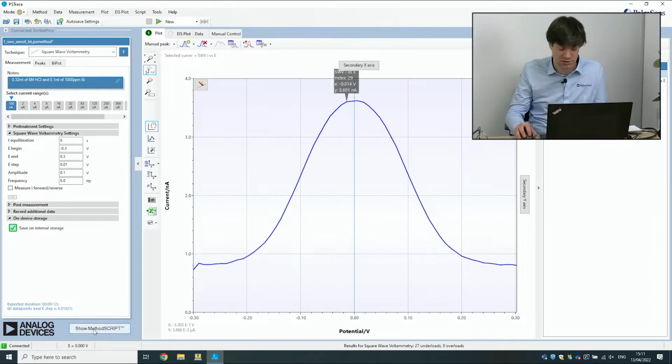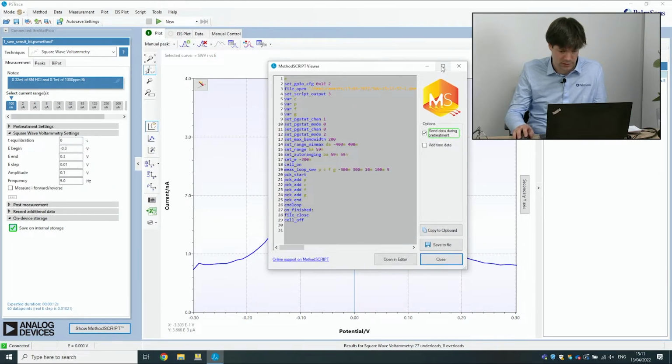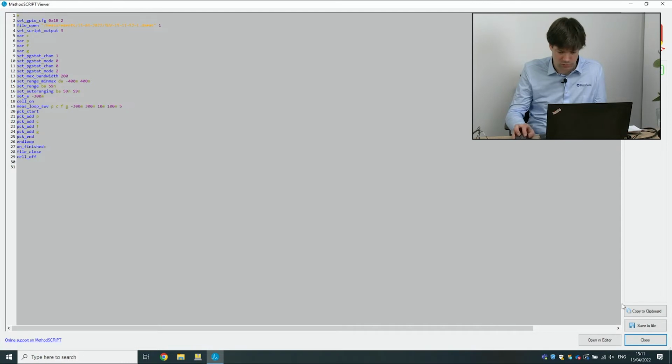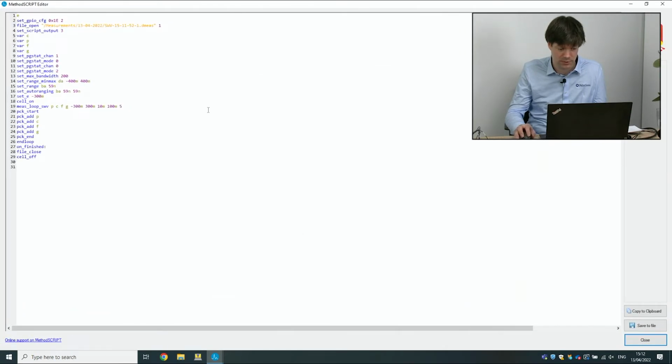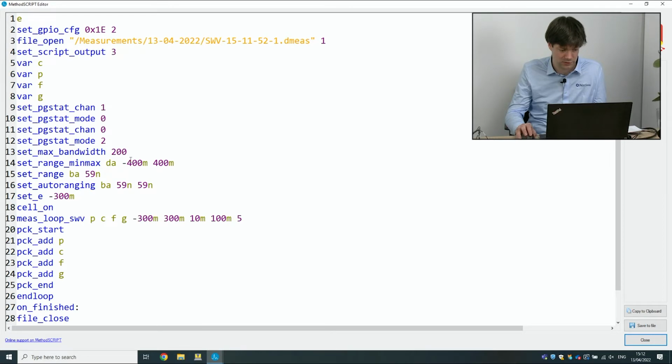Now we're going to add some extra features to it using MethodSCRIPT. So these are things we can't normally do in PSTrace. To do this, we first generate a script like Lutz has showed before, and a button that wasn't shown earlier is here in the bottom right. There's an open in editor button that will take you to the MethodSCRIPT sandbox. This is just an editor that you can use to edit MethodSCRIPT.